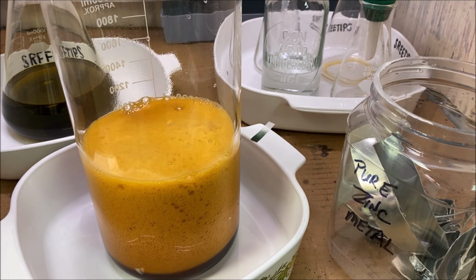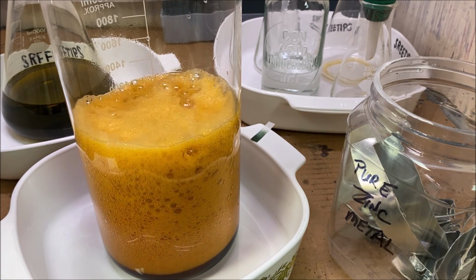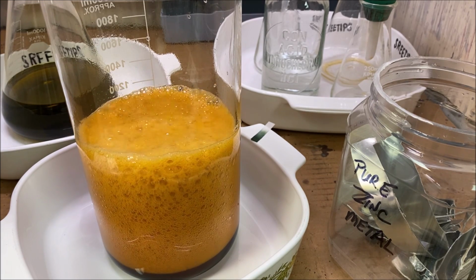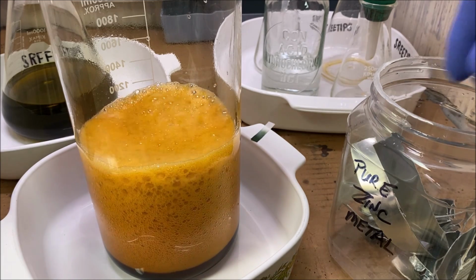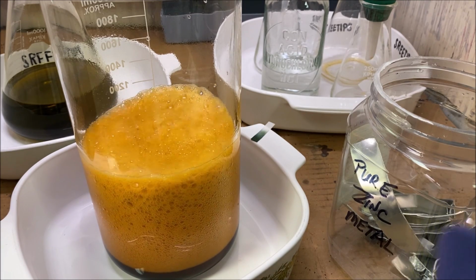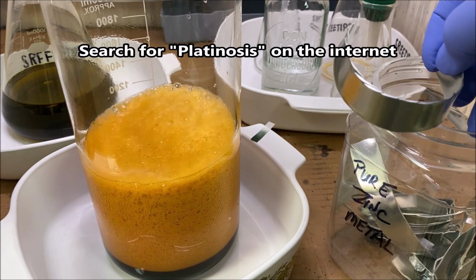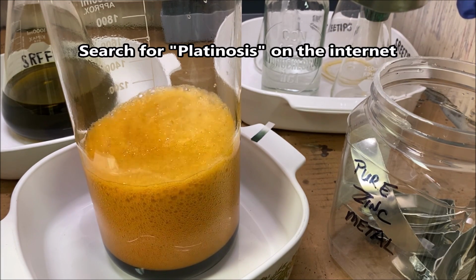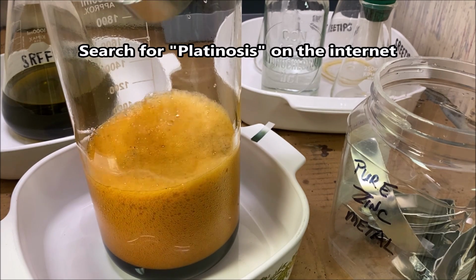And when this is reacting like this, it's putting a finely atomized spray of platinum group metals into the air. That's why I'm doing it in my fume hood. If I didn't have this fume hood drawing the air away from me, I'd be breathing finely atomized droplets of platinum group metals. If you don't understand why that's so dangerous, look up the word platinosis on the internet, and you can read about what illness a person would get by getting some of this platinum in solution on your skin.